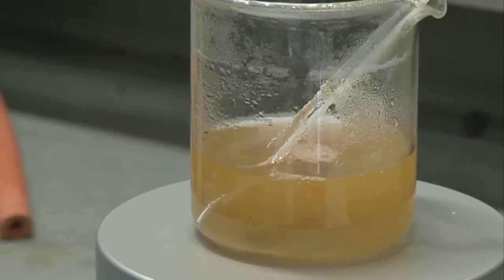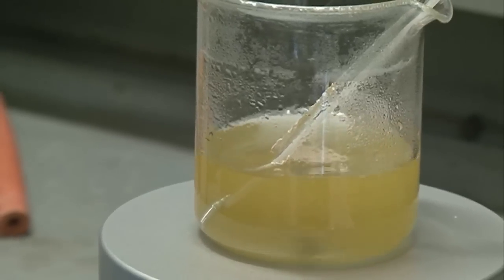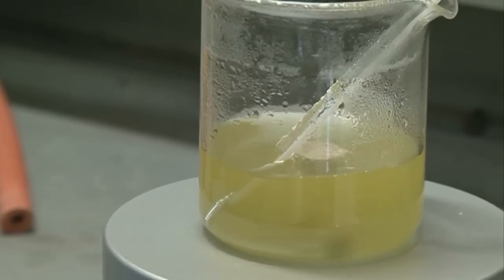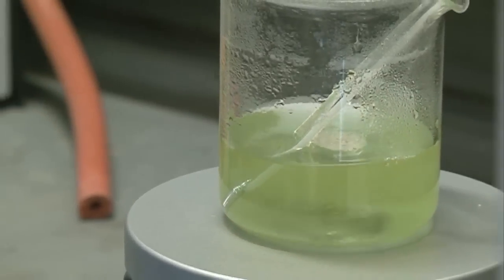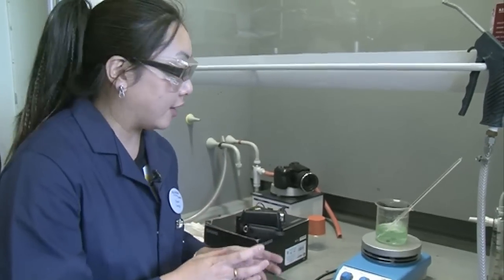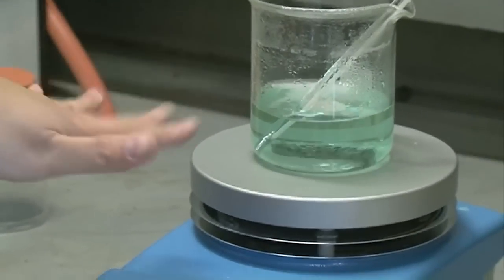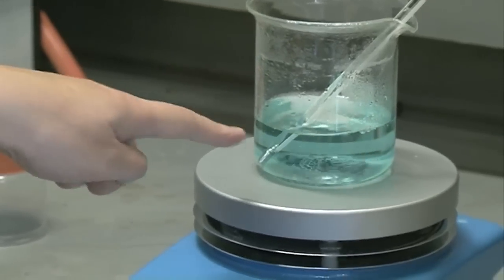The colour's gradually changing. It's gone from orange and now kind of a murky yellow. You can see it's kind of green now. It's a gradual change — it wasn't a sudden, spontaneous change straight back to being blue and clear. Now we've got back to that clear solution. You can see on the stir bar all the bubbles of oxygen, a little bit of CO2 forming on that.